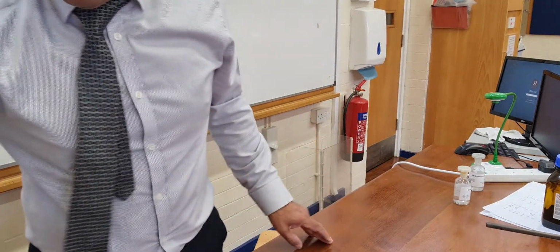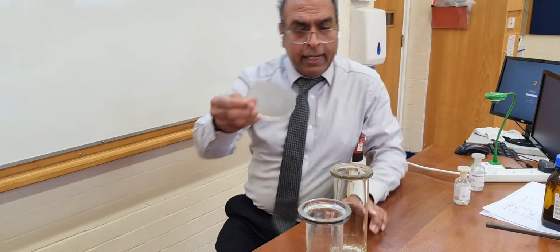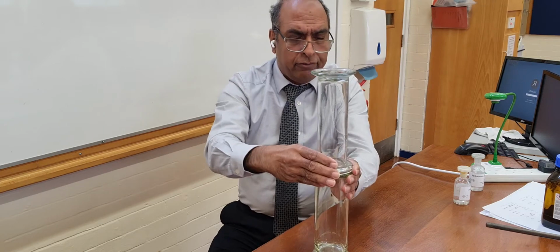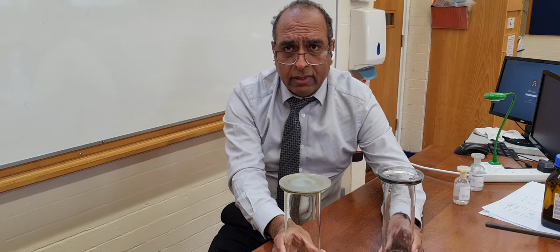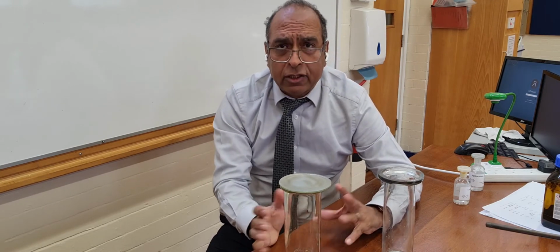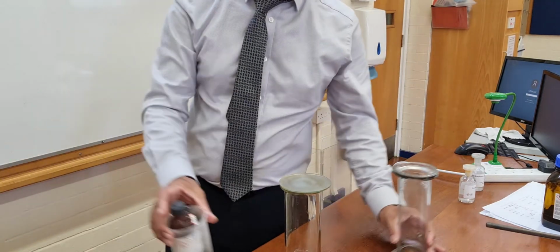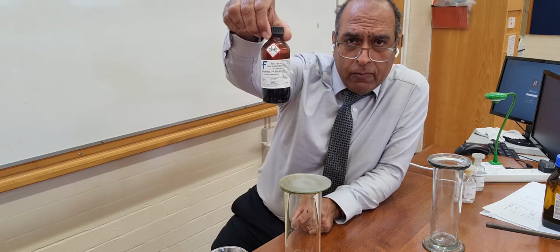The final demonstration is something I've got to be careful about in terms of safety. So I've got here a gas jar and another gas jar. You just check the two gas jars do fit over each other. Now, to show you diffusion in gases, ideally we want to have a gas that is coloured so we can see it spreading out. Now, there aren't many gases open to us that are coloured. I mean, chlorine is coloured, but it's not coloured enough. What we actually use is this nasty stuff here, bromine.